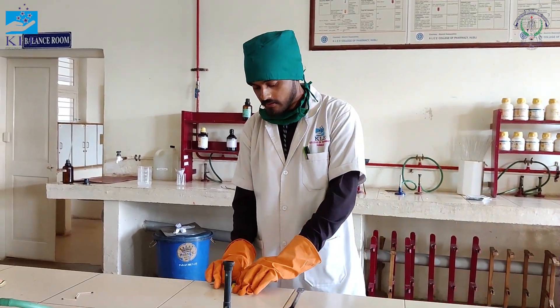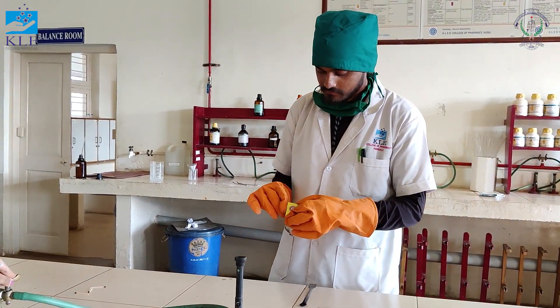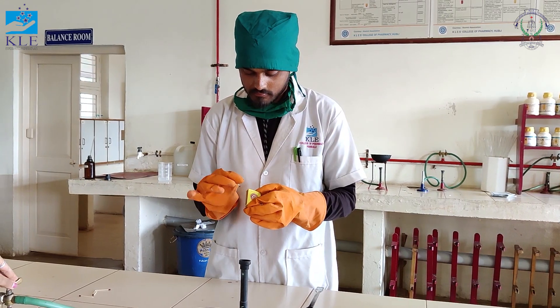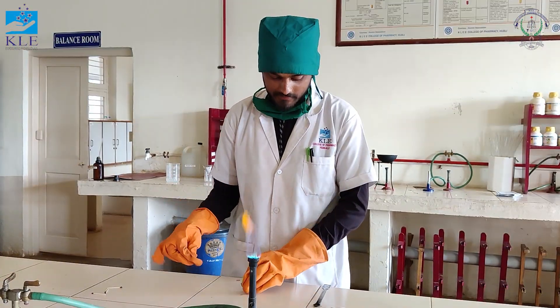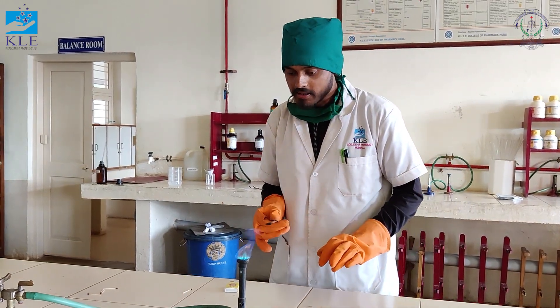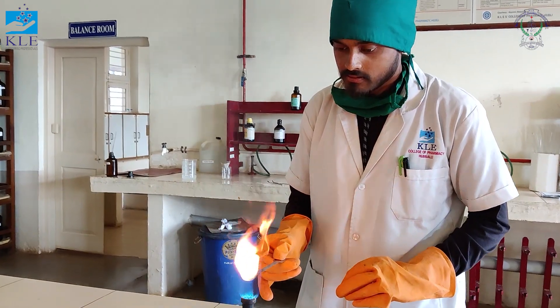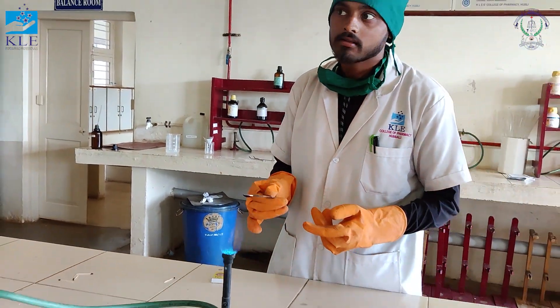The second test is the ignition test. Take the compound in a nickel spoon and burn it. It burns with soot. Therefore, it is aromatic.